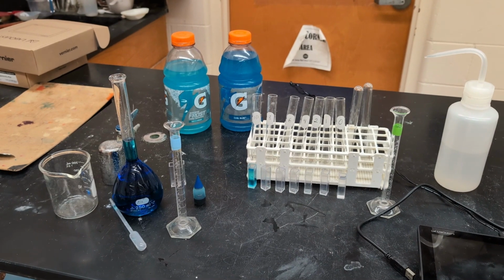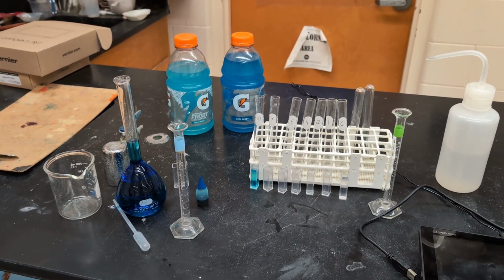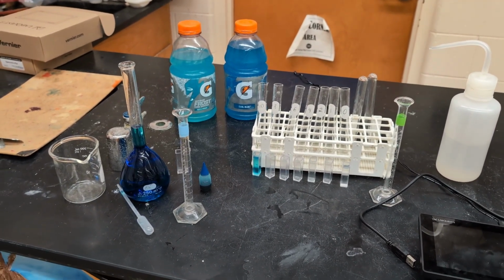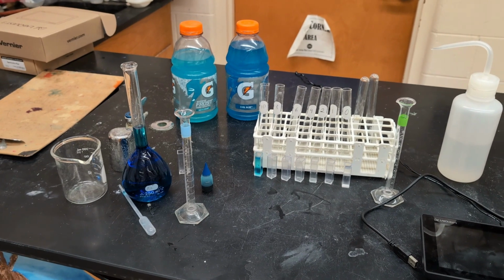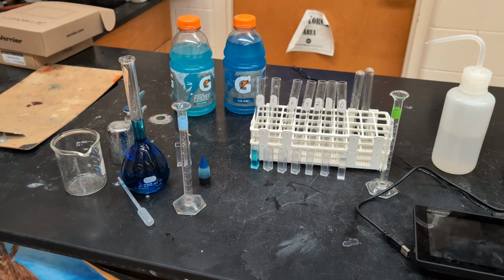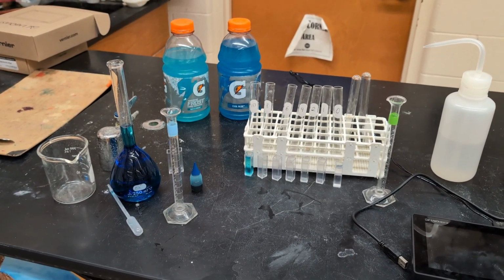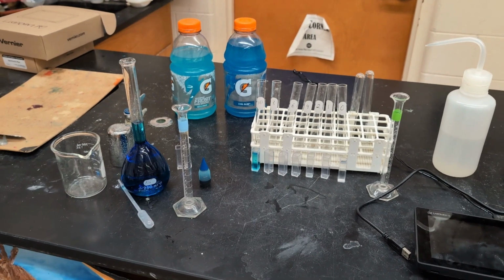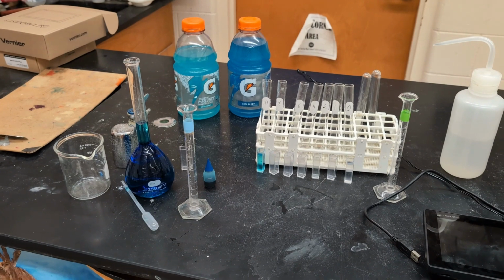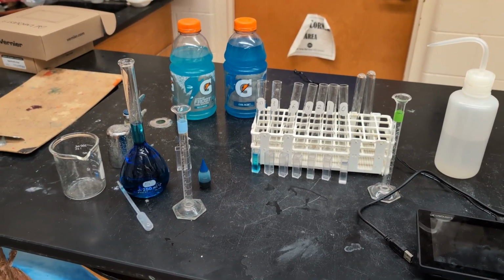You always want to make sure that your stock solution winds up with an absorbance between 0.8 and 1.2. If it's higher than 1.2, it's not really a valid measurement in your spectrophotometer. But if it's less than 0.8, then when students dilute it, it's going to get to a very, very low concentration that might not be valid either. So look for that range. The solution that I made wound up with an absorbance of 0.933, so it was right in the perfect range there.